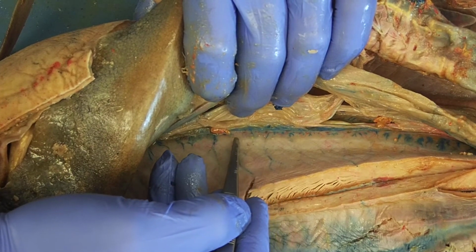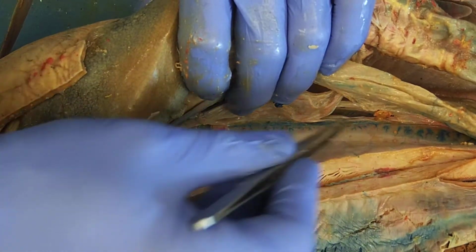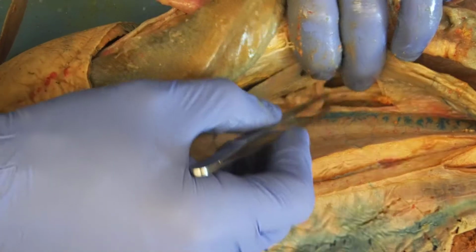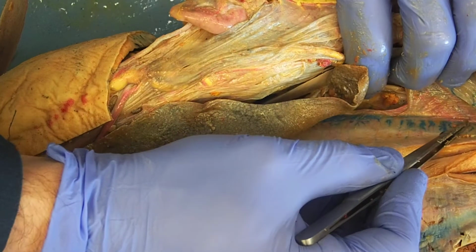That's the kidney. In the female, the kidney is functioning as a kidney. It's filtering blood. And it's going to drain via archenephric ducts, which are going to be the small ducts running. See them right here.